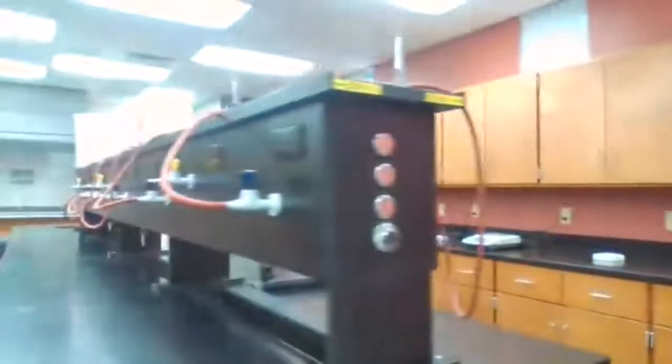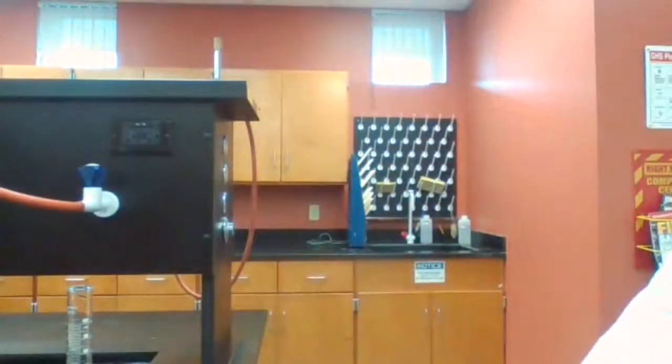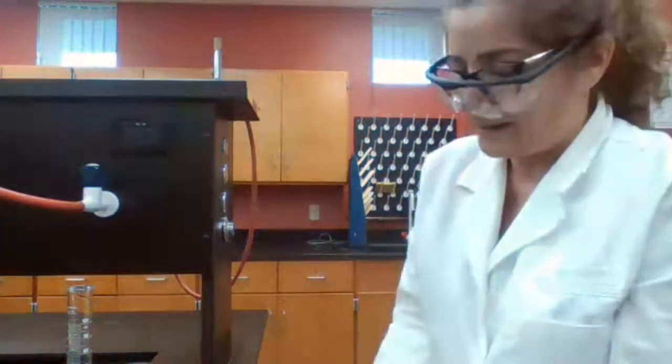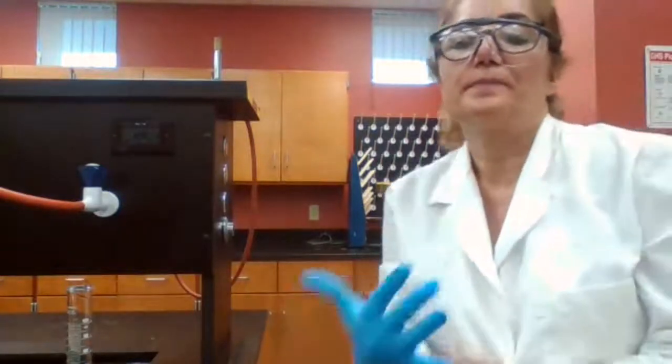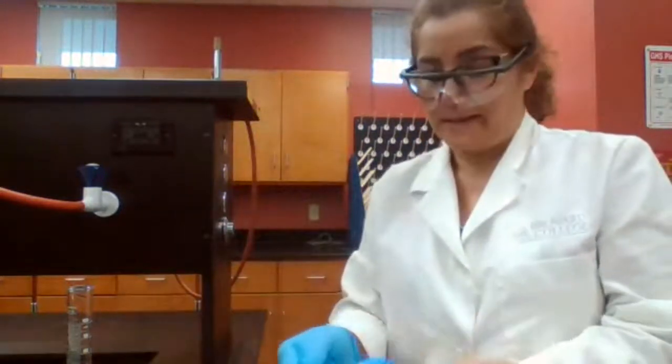The procedure is going to tell you when to get the mass of the filter paper, when to get the chemicals, and what each step is. So I want you to tell me, using the procedure, what is the next step after measuring 0.4 grams of copper. Place the copper in a 250 mL beaker. Yes, very good.